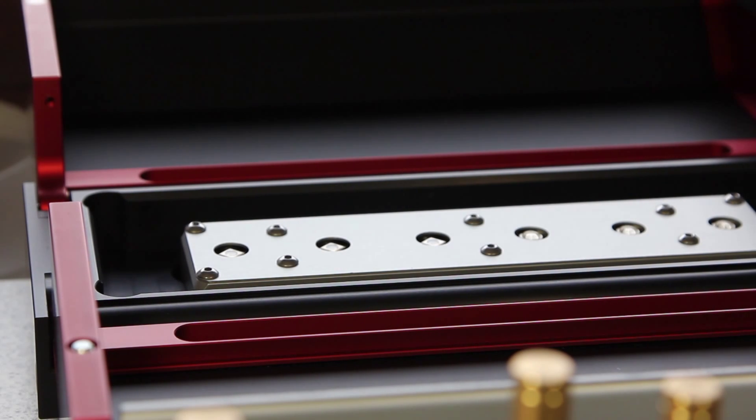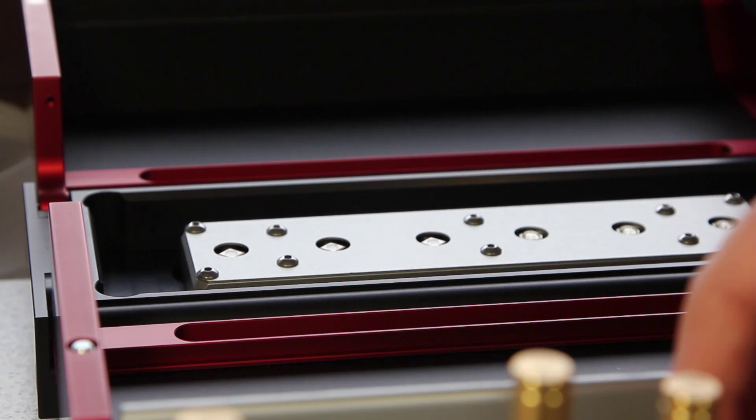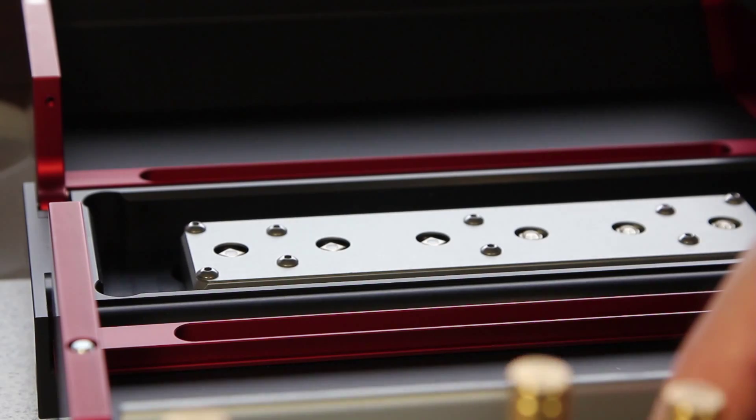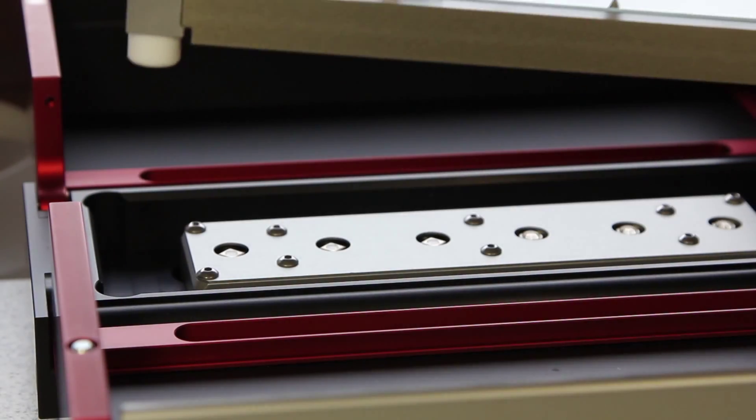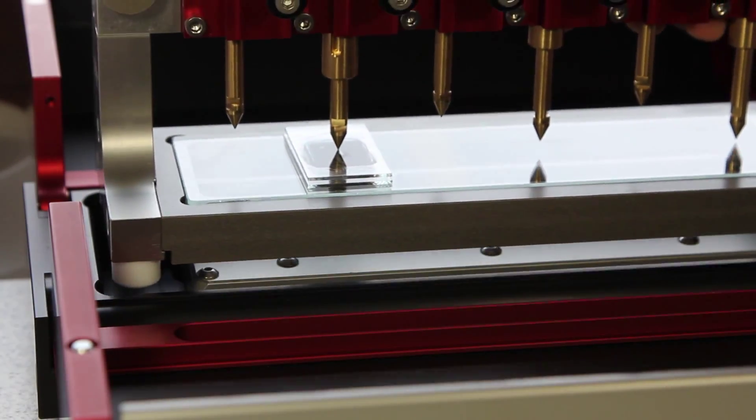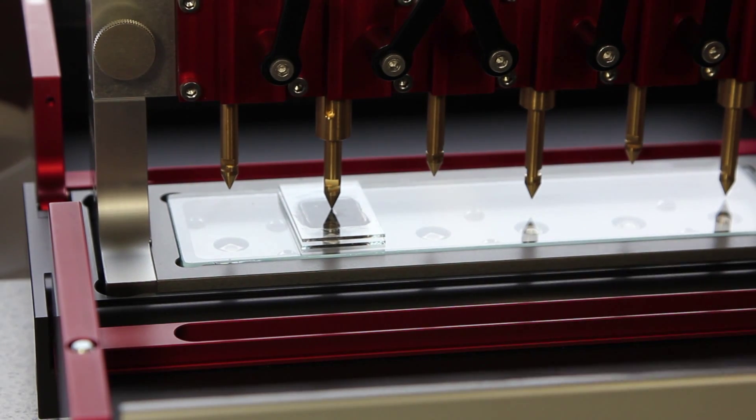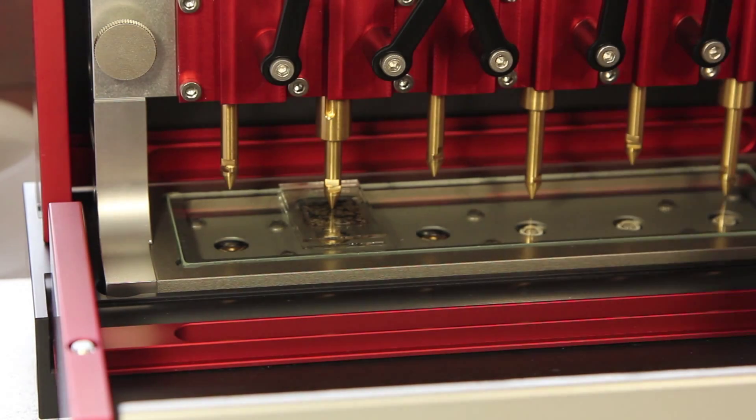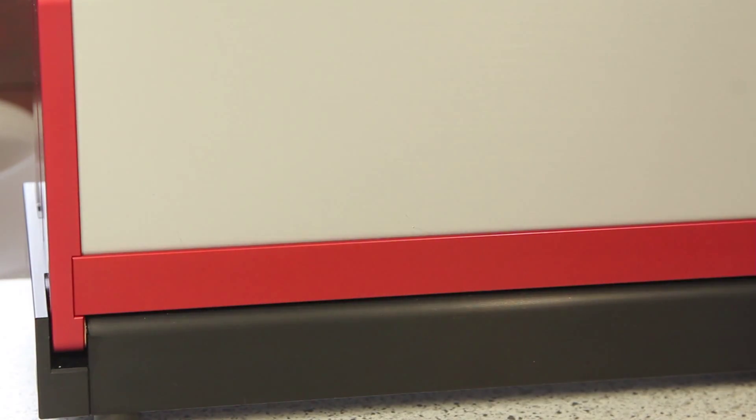After 2 or 3 minutes of waiting time which allows the layer to get very thin, I put it into my UV case and I start it.